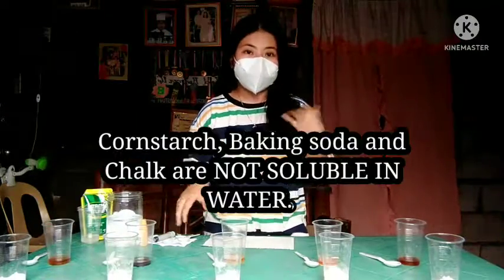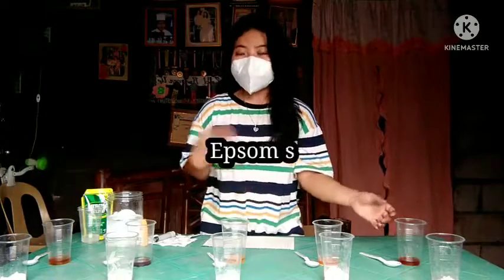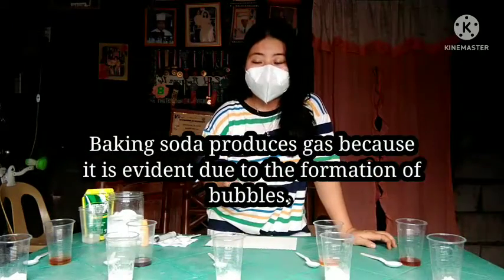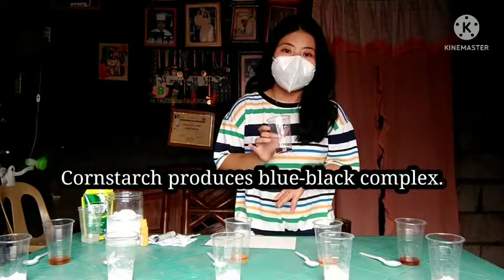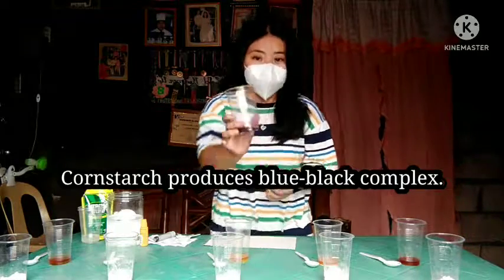So to summarize, cornstarch, baking soda, and chalk are not soluble in water, while table salt and Epsom salt are soluble in water. Also, baking soda produces gas among these everyday chemicals, while cornstarch is the substance that produces the blue-black complex.